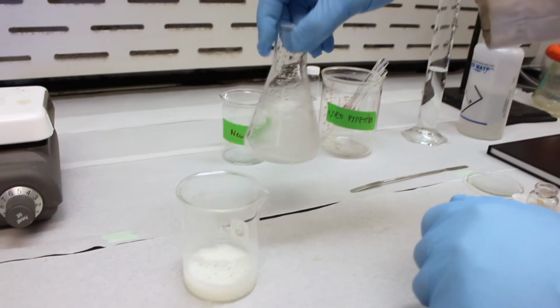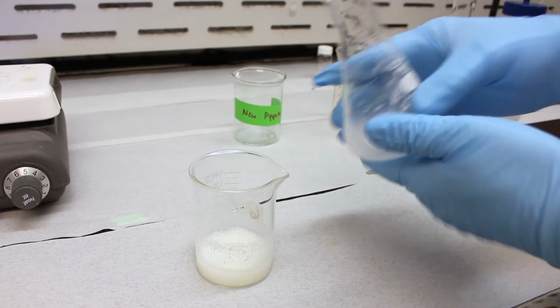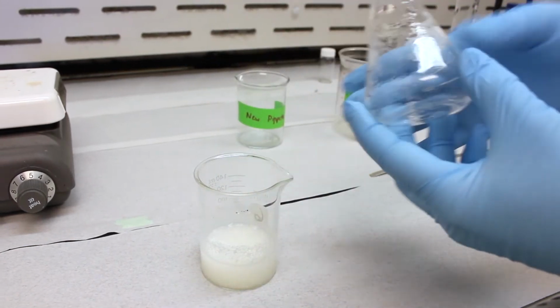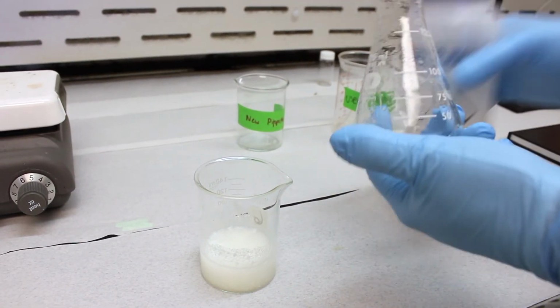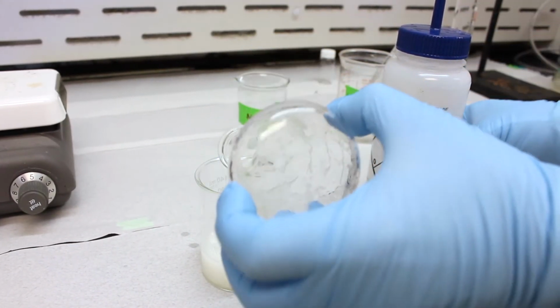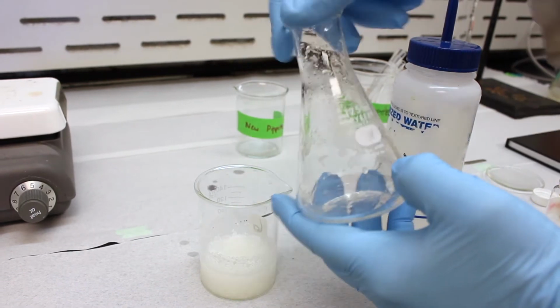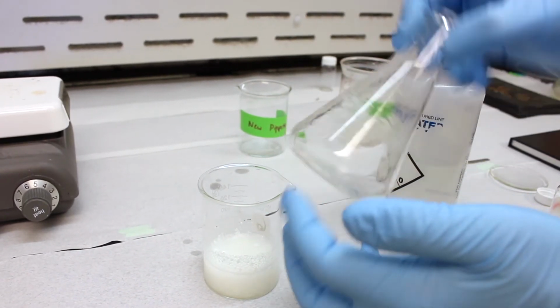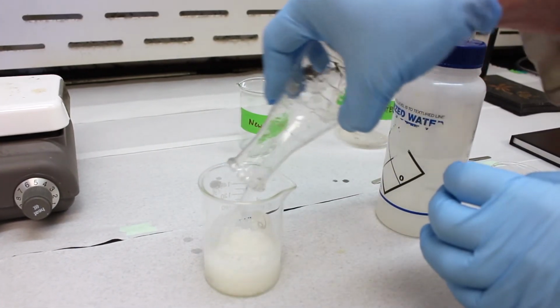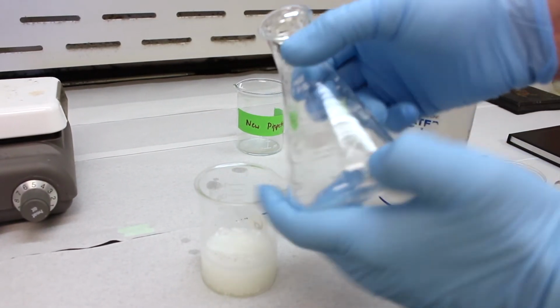And swirl it around a little bit. Maybe we'll do it a few more times. See, there's still a little bit right here, so try to shoot it off. And we've got the majority of it, so this stuff we might not be able to get out, and that's okay. That's probably a few milligrams worth, not that much.